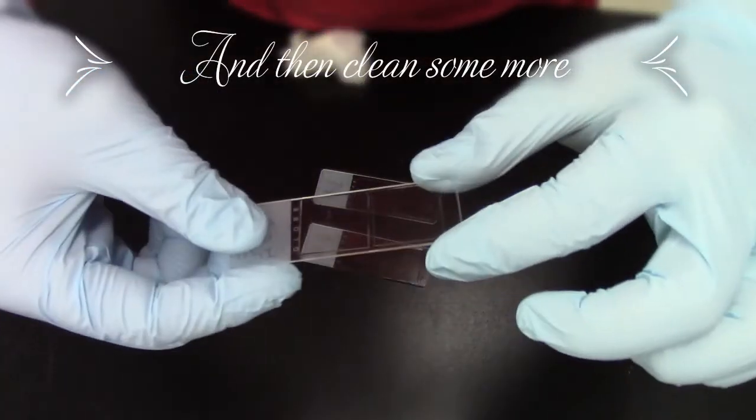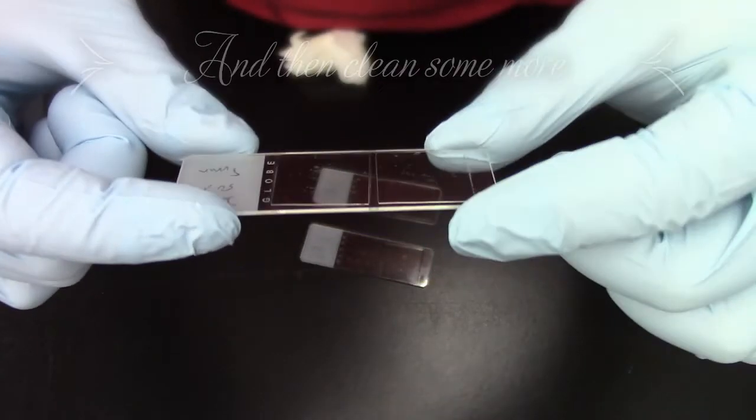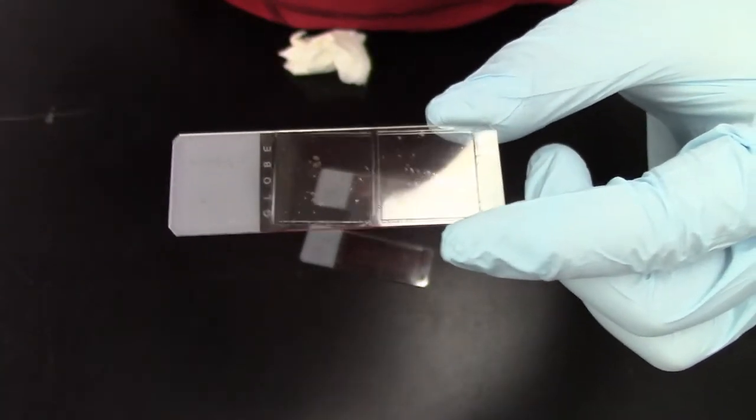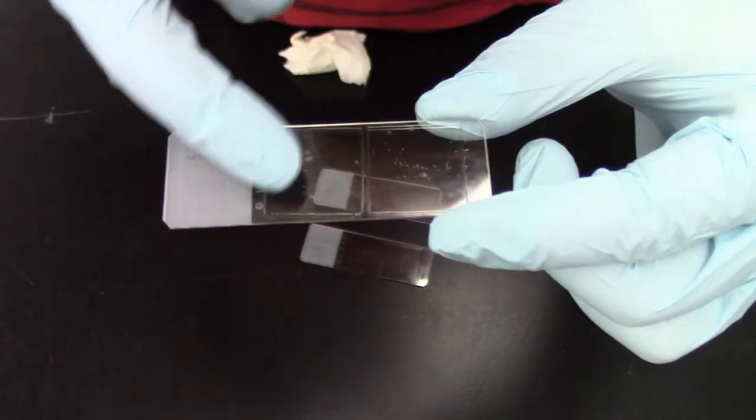So I have three slides and we can actually have a look at them. I cleaned all of them so you can appreciate how nice and clean they are right now. So you can see that there is no more haze. And I am particularly worried about haze on top of the coverslip. So you can see that the coverslip is nice and clean.